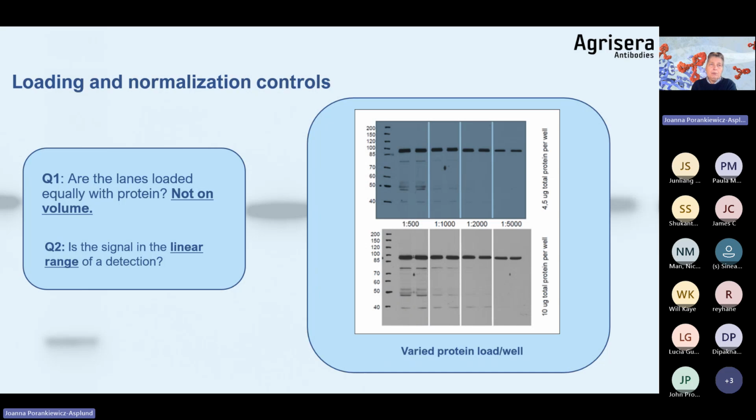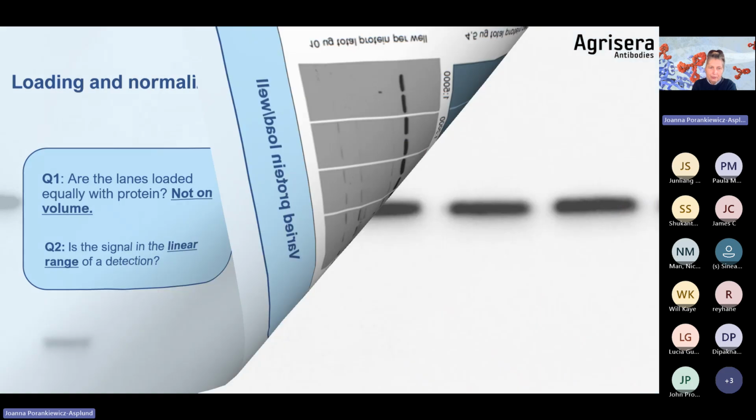We have two blots. Upper blot has load protein per well of 4.5 microgram, and at the bottom we have 10 microgram per well. And then we are titrating the primary antibody dilution, which is used in different dilutions, and that way you can titrate where you will have the most optimal and linear detection range. Of course, it will also depend what detection reagent you are using, but please measure protein concentration in your samples and load based on the protein, not on the volume.